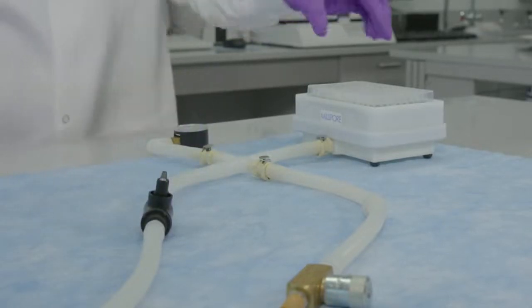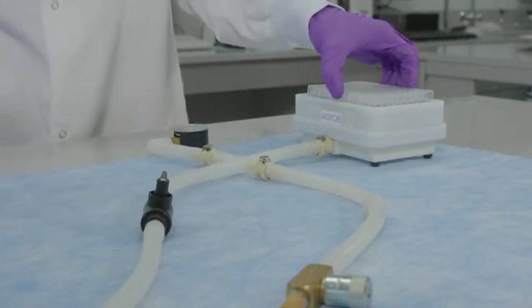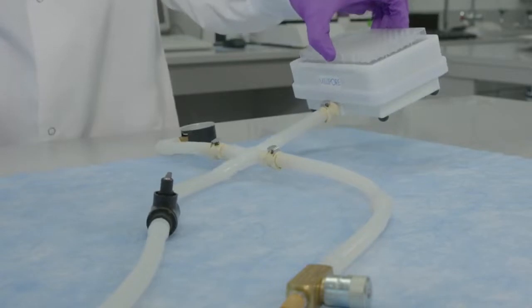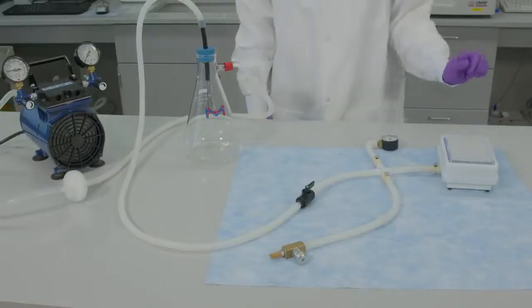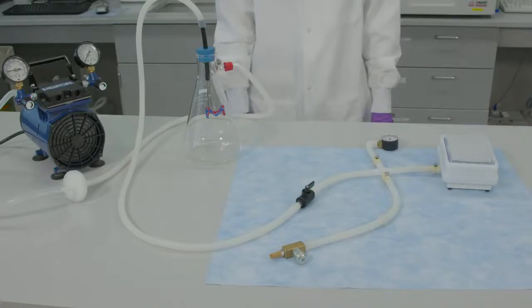The plate should seal within a minute. You should be able to pick up the plate and have the manifold lift off the bench as well. This illustrates that the vacuum manifold is functioning as expected.